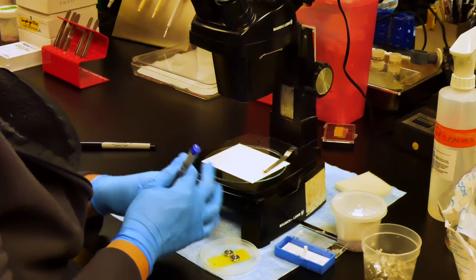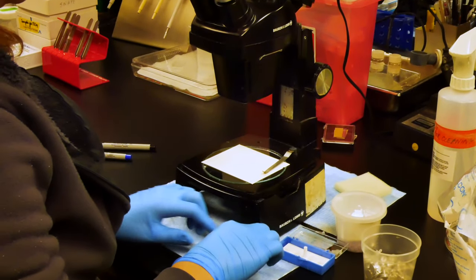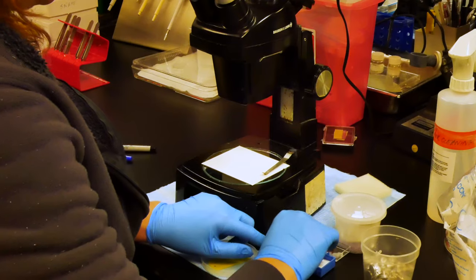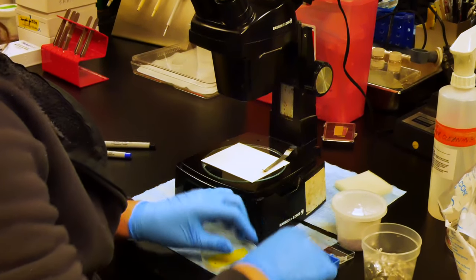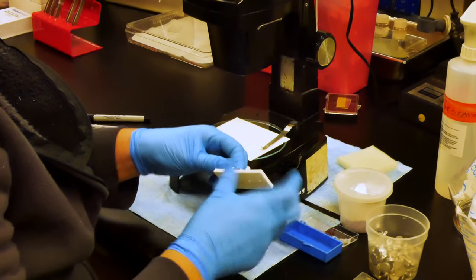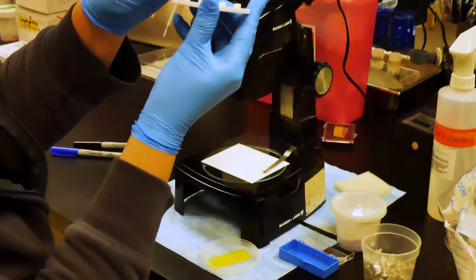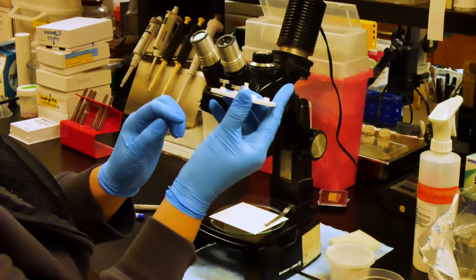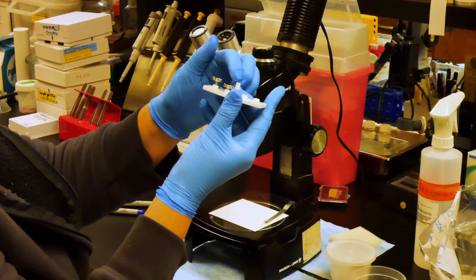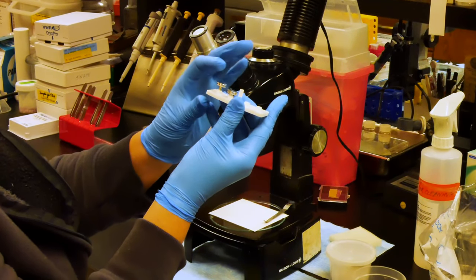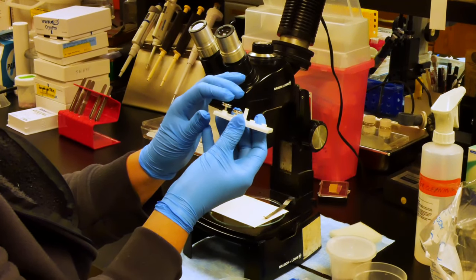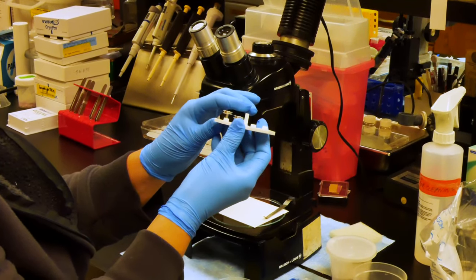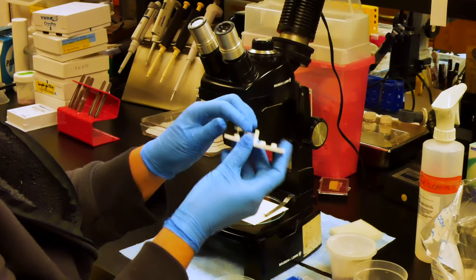Now that those are labeled, I will secure them in the holder. So here is a long one and here is a short one. We actually use primarily the short ones. The long ones can be used with our system but require a bit of loading modification, so it is best to avoid the longer ones.